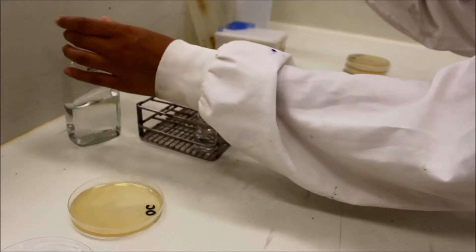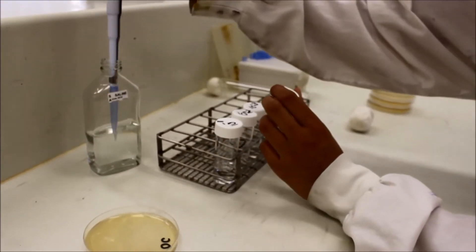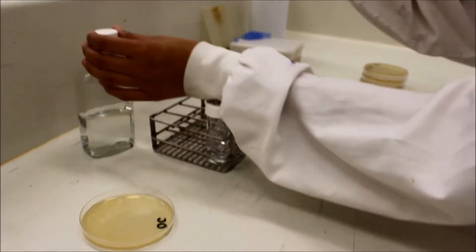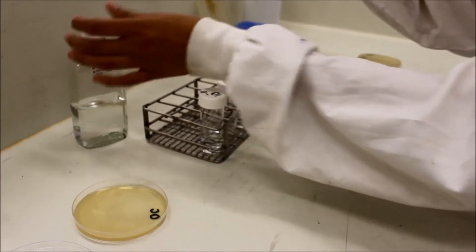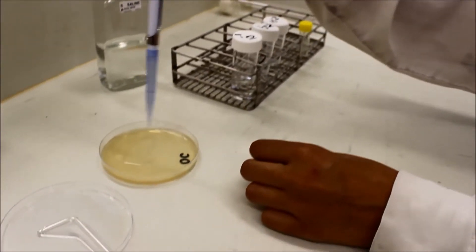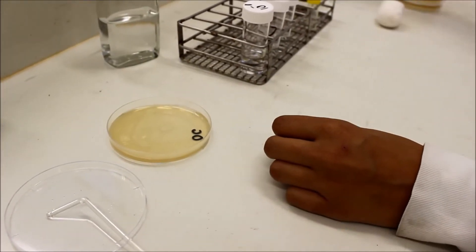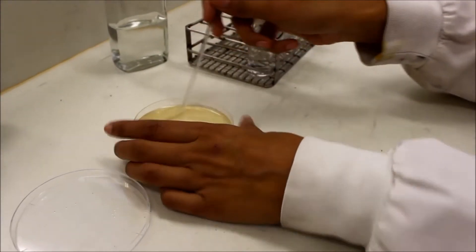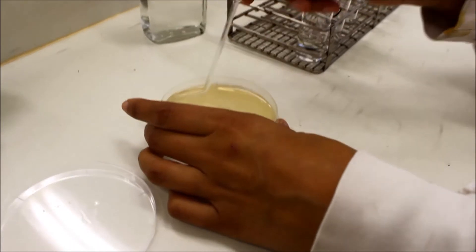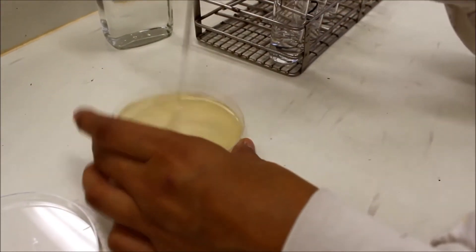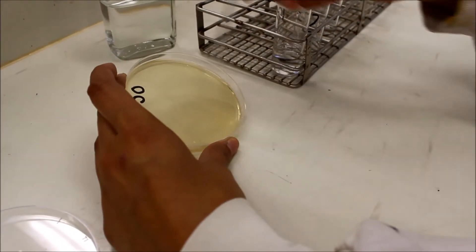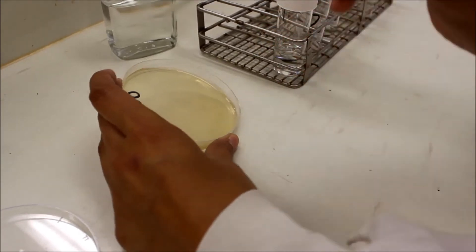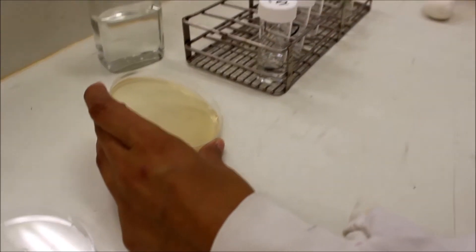Repeat this wash again by spreading saline on the surface of the same plate. Once again, collect the excess saline.